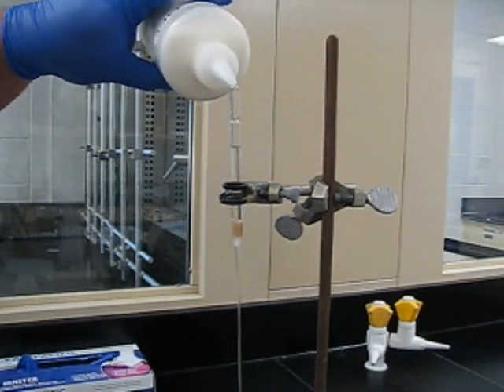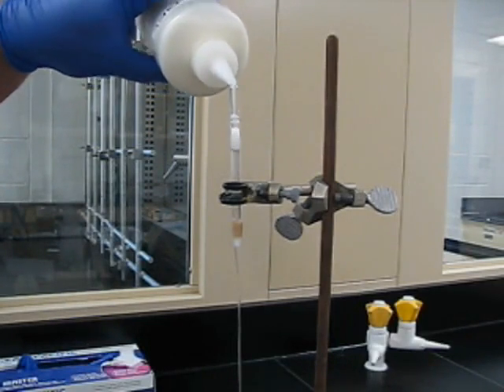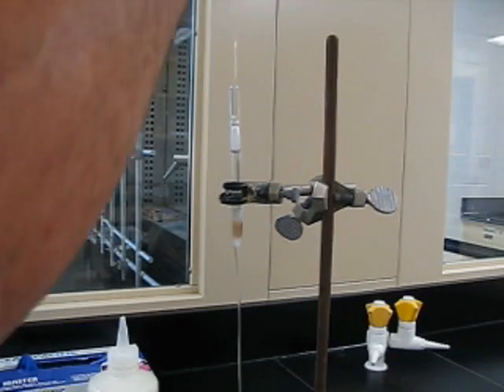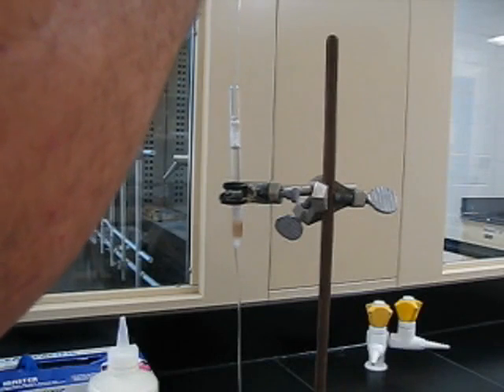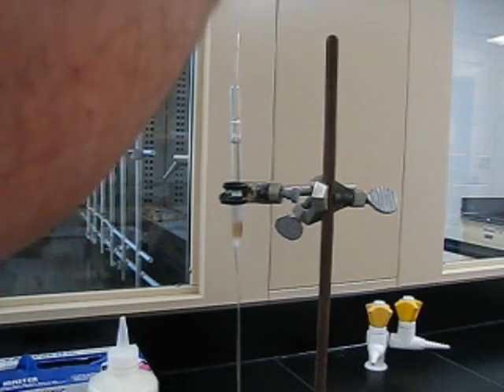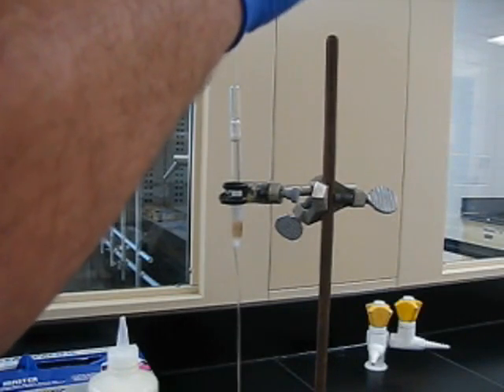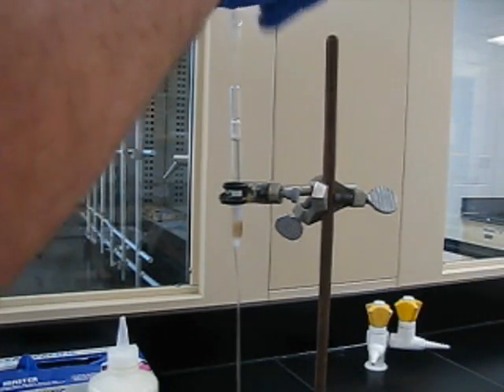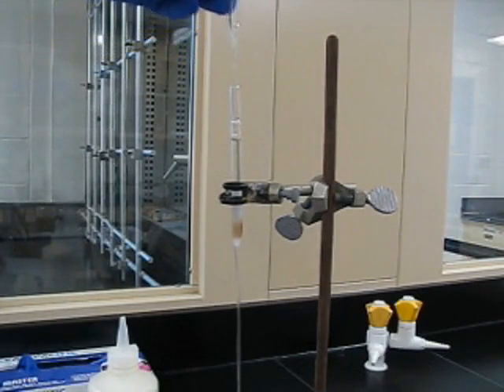Anyway, start pouring in some of the silica gel. And you're going to see that you need to push it down in with a pipette. And not only push it in, but once it gets down there, mix it around a little bit. Because you're going to see there are a lot of air bubbles that need to be released. And you don't want this happening while the column is running or once you've filled it up with silica. So you're going to add a little bit of silica at a time.